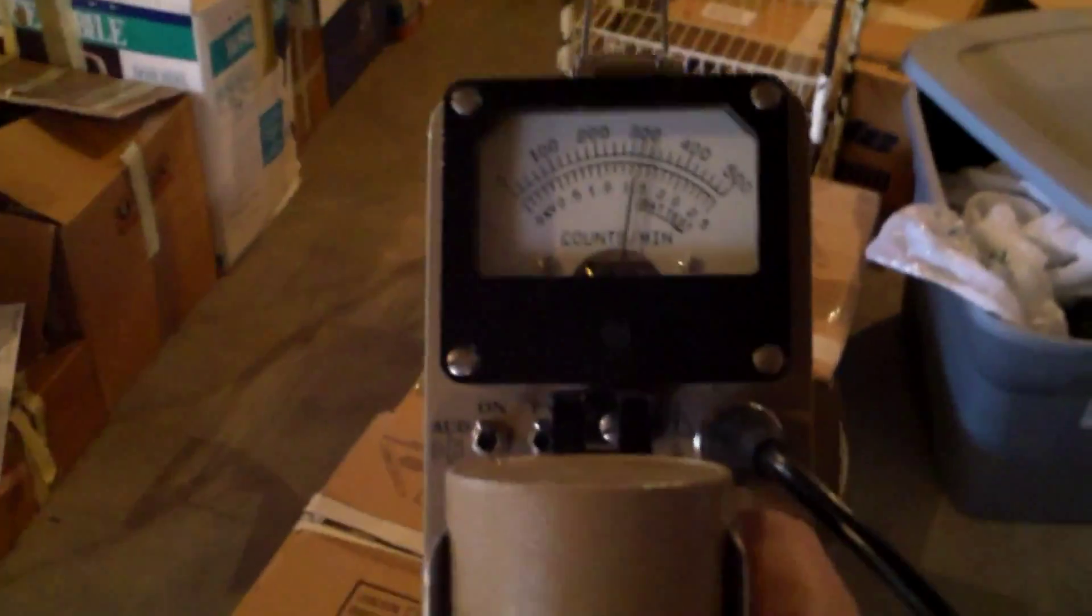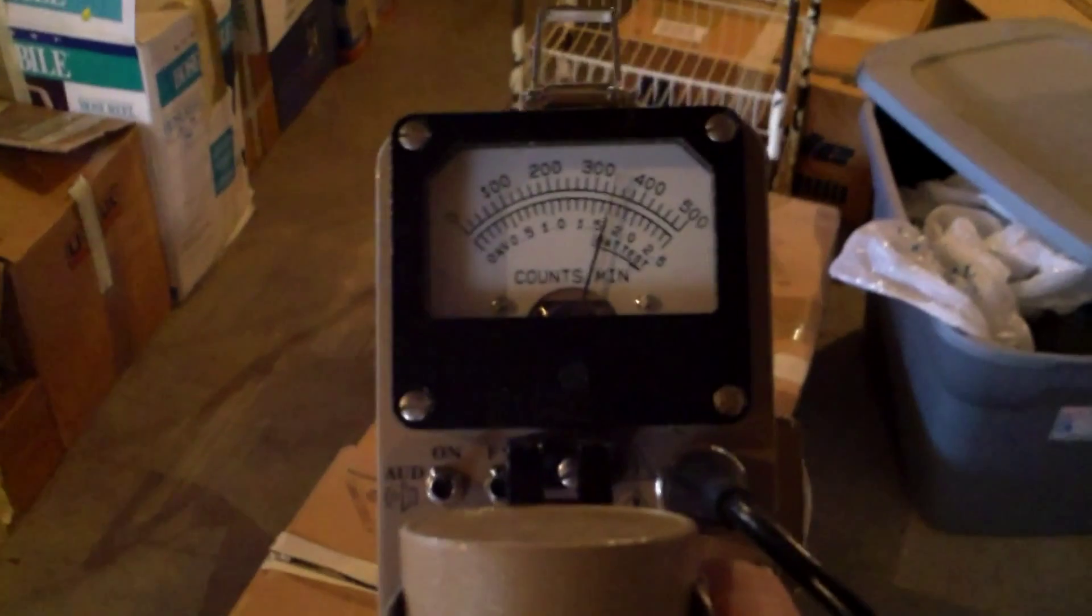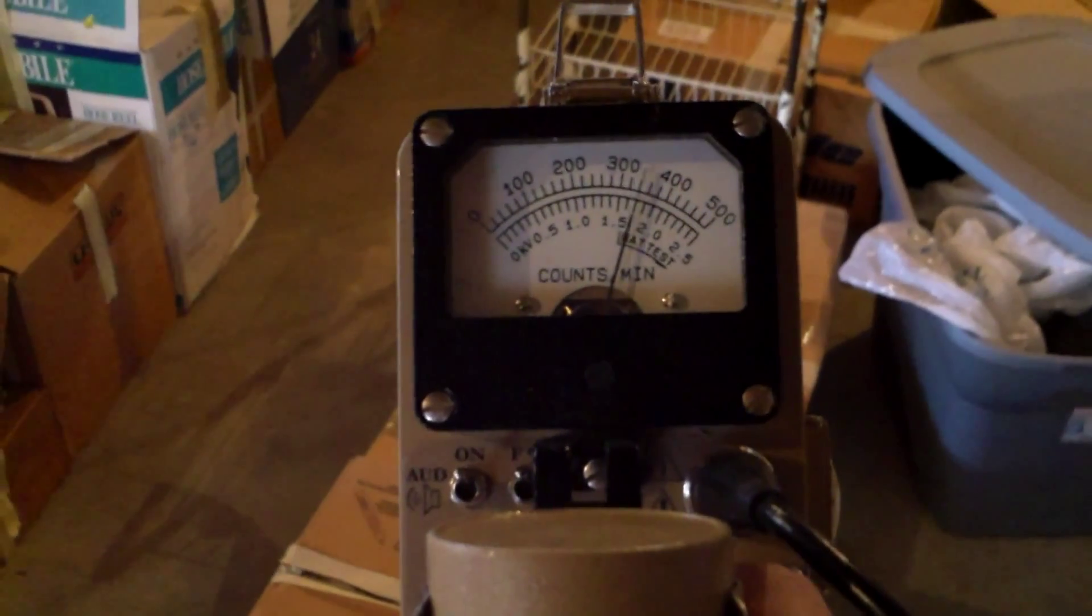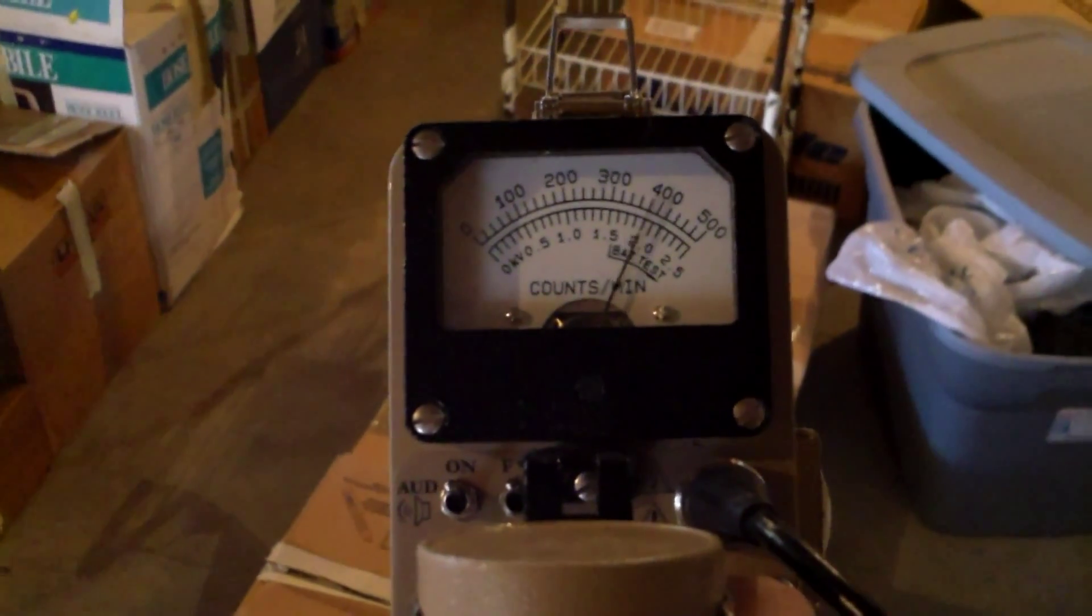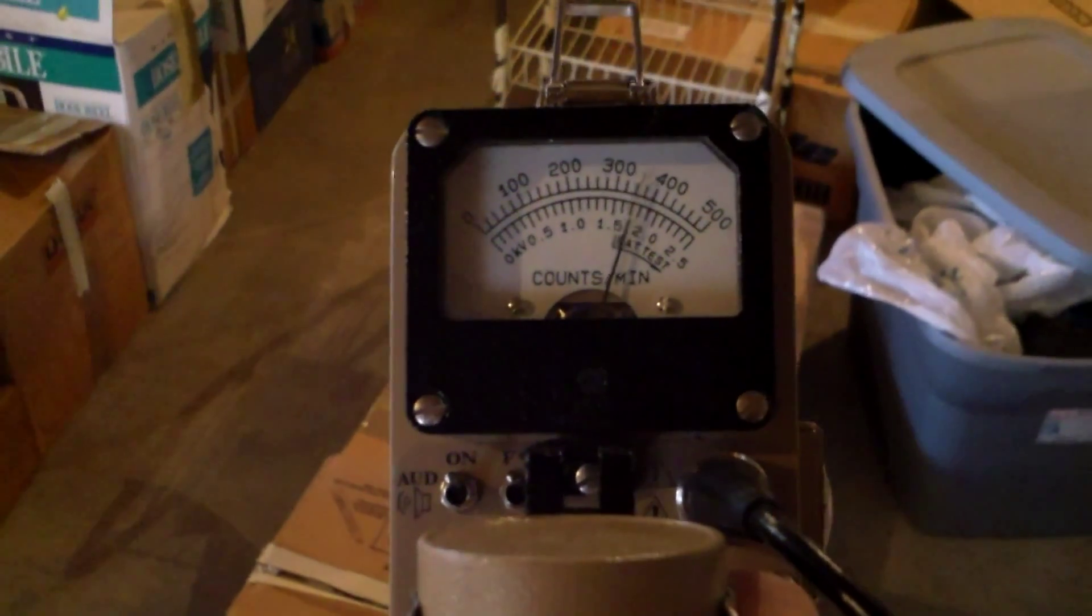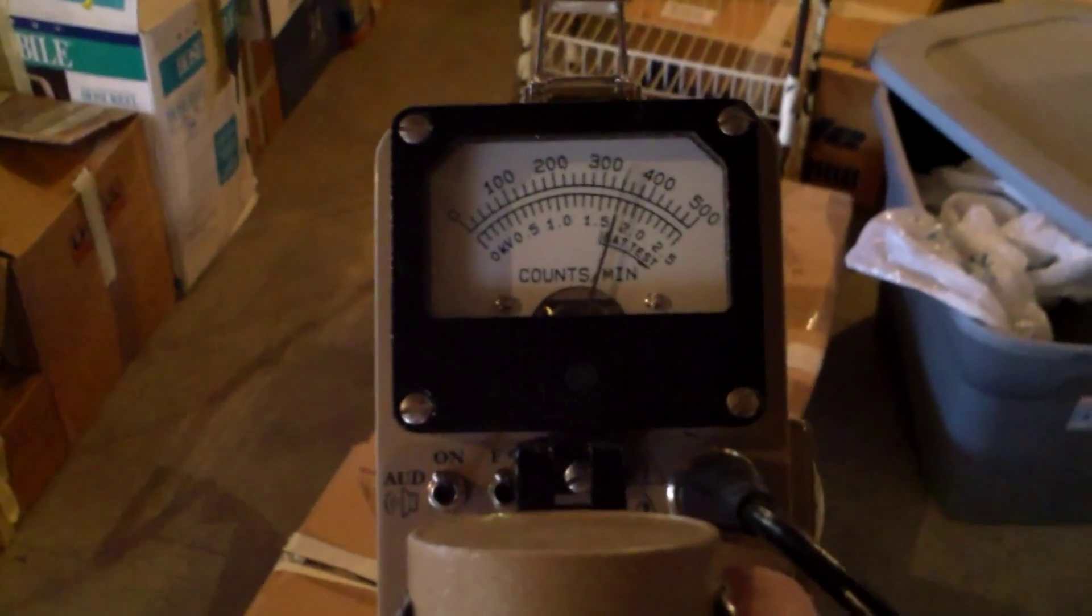Now, it's going back up again. So, I guess that is correct. So, let's switch now to the last but not least, the times 1000 mode one more time. Times 1000, so we're settling back down again. And let's walk back.